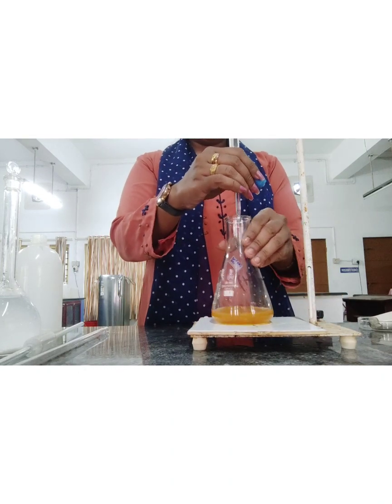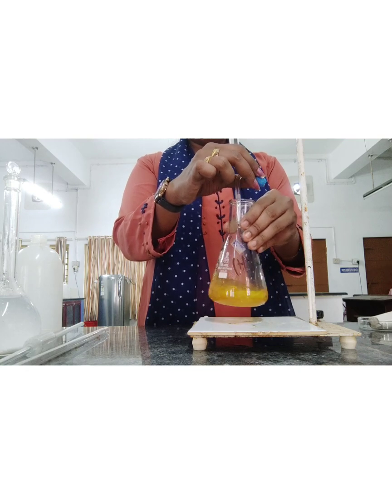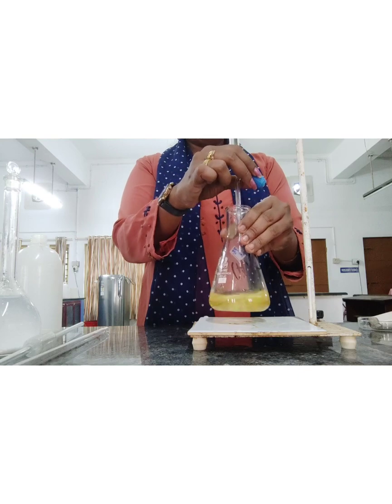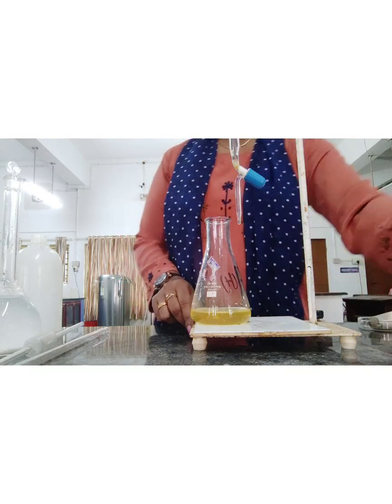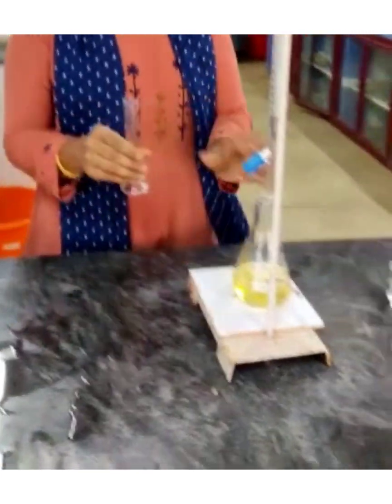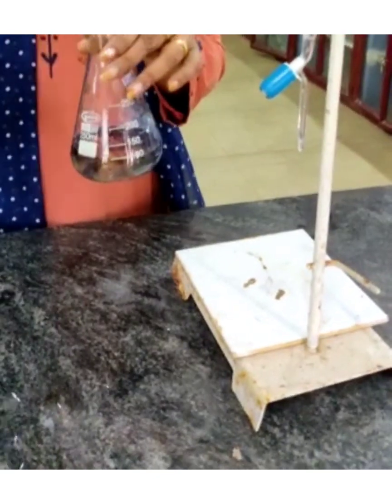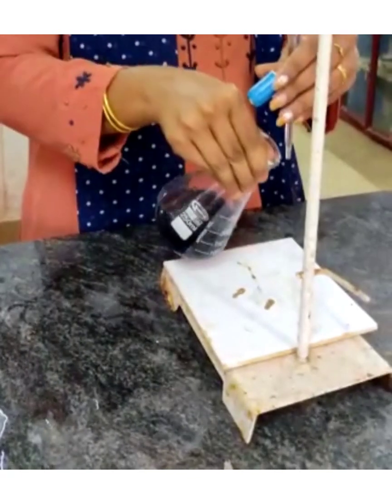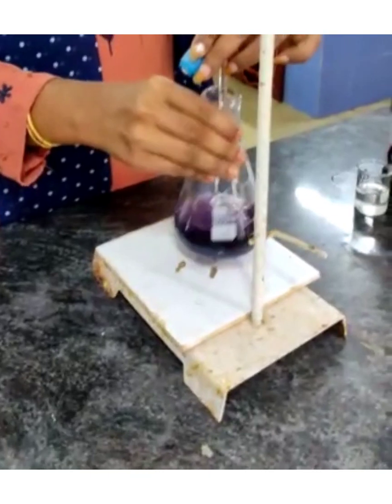Titrate the solution with 0.025 normal sodium thiosulfate from a burette. When the solution becomes pale yellow in color, add 5 ml of starch indicator. The solution will now turn blue in color. Continue titrating with standard sodium thiosulfate solution until the blue color disappears.